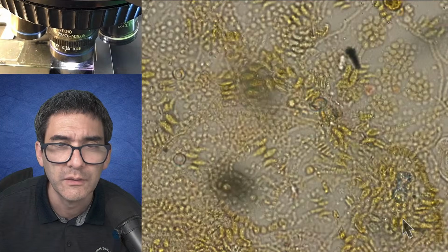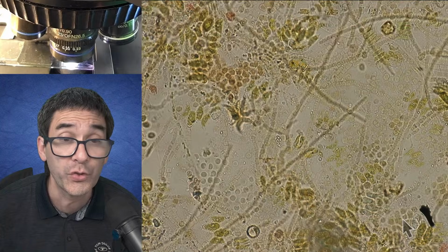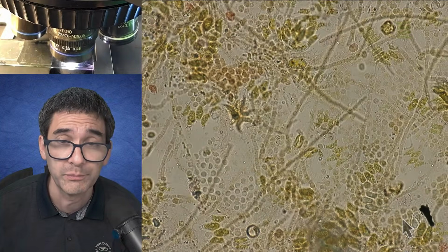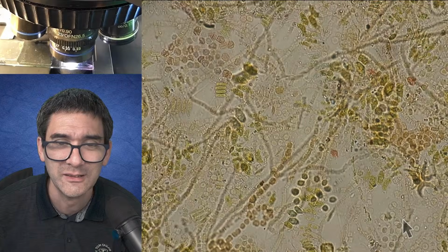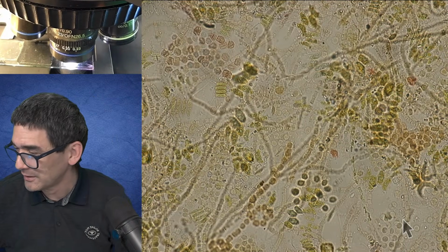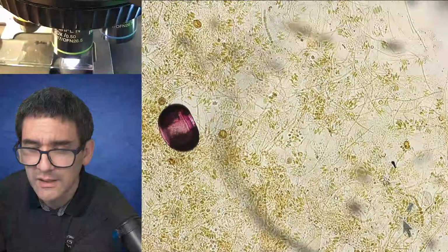Nothing unusual, because of course pigments very often start to bleach. I think it was a couple of weeks ago when I showed you some slides that were over 30 years old. They were almost completely free of color. Okay, just a little bit of an evaluation on how the slide quality actually is.